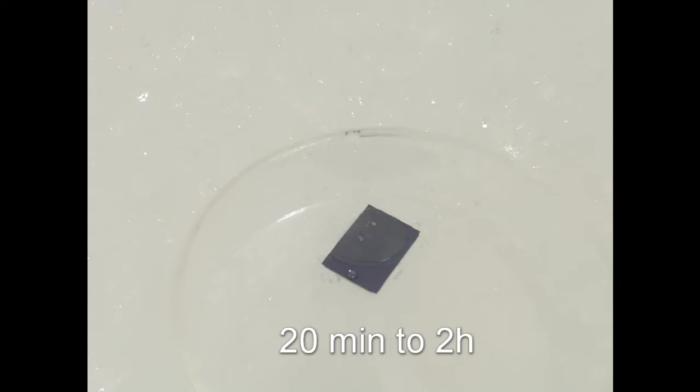If the cyclohexane layer is very thin, one can also let it melt. However, in that case there is a risk that graphene will be carried away with the liquid. So we prefer and recommend evaporating cyclohexane from the solid phase rather than liquid.